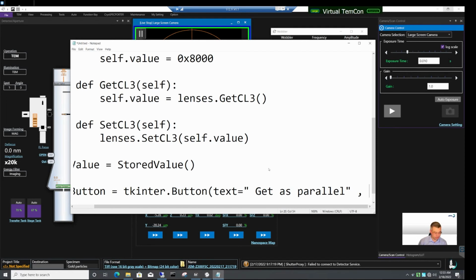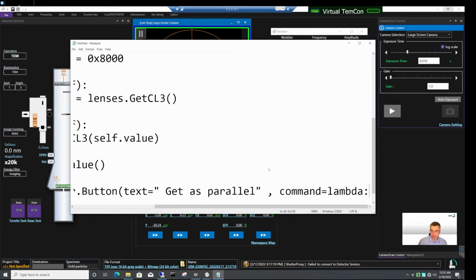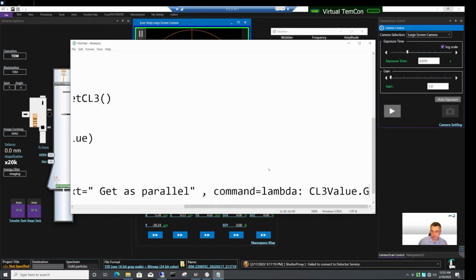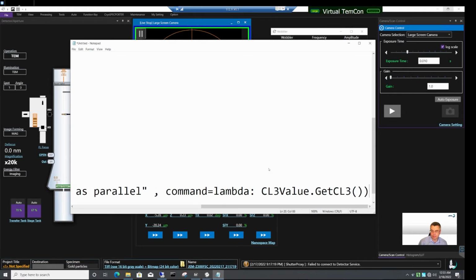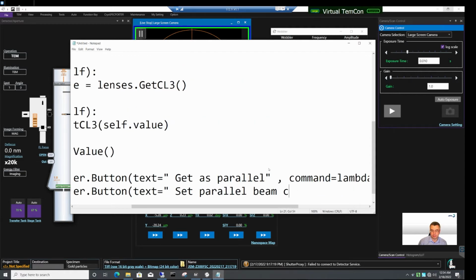and clicking on this button will invoke a command. I am going to use the lambda expression here to call the CL3 value getCL3 method. There are other ways to do it, however I think that lambda in this case is probably the best approach. And then we need a set button. This is tkinter button again, and then here the text will be set parallel beam conditions.